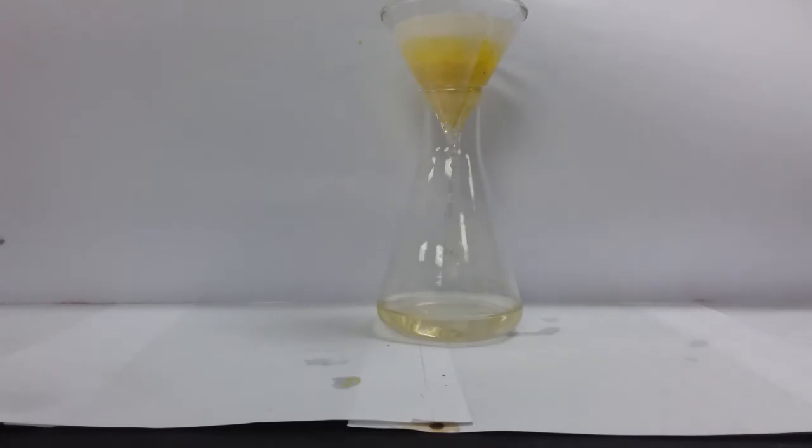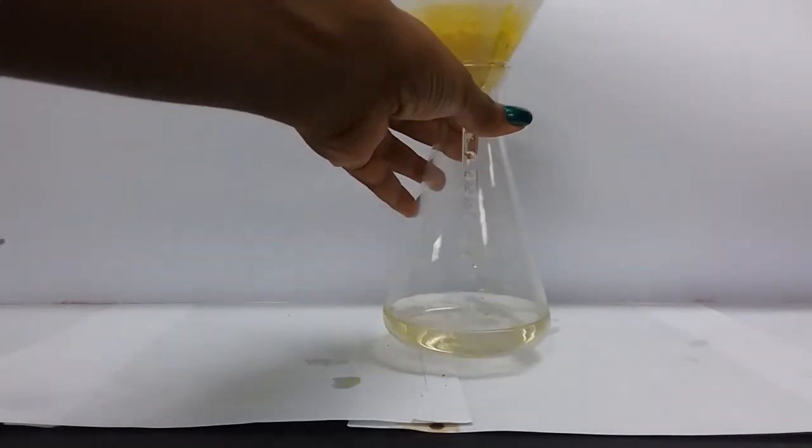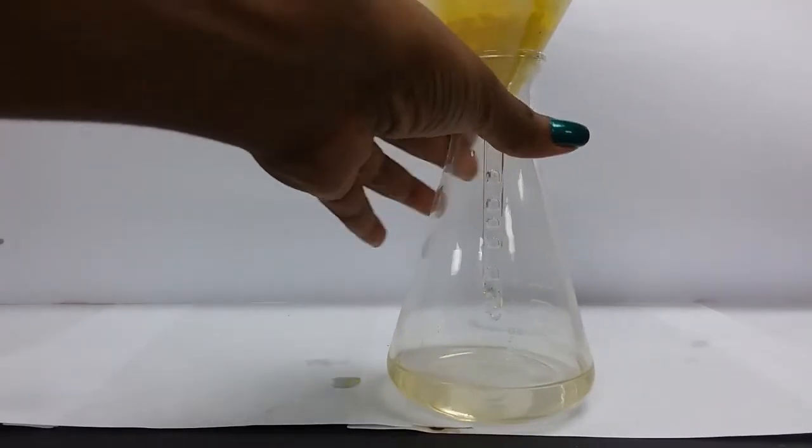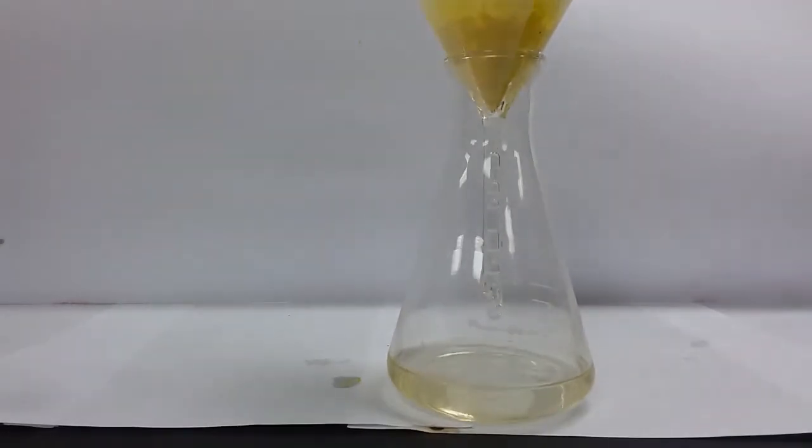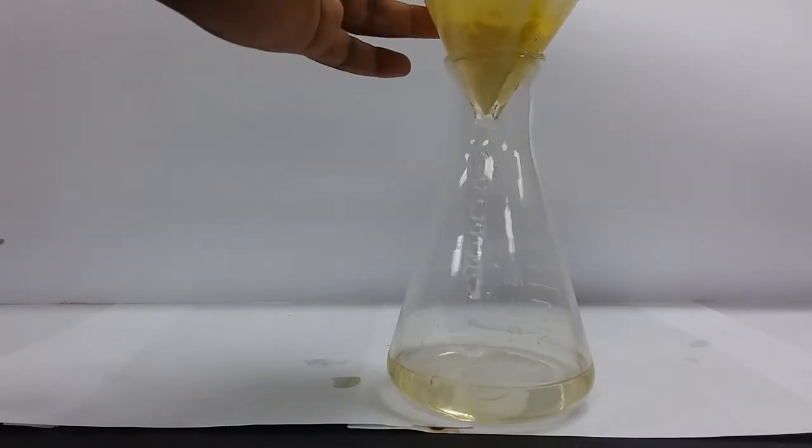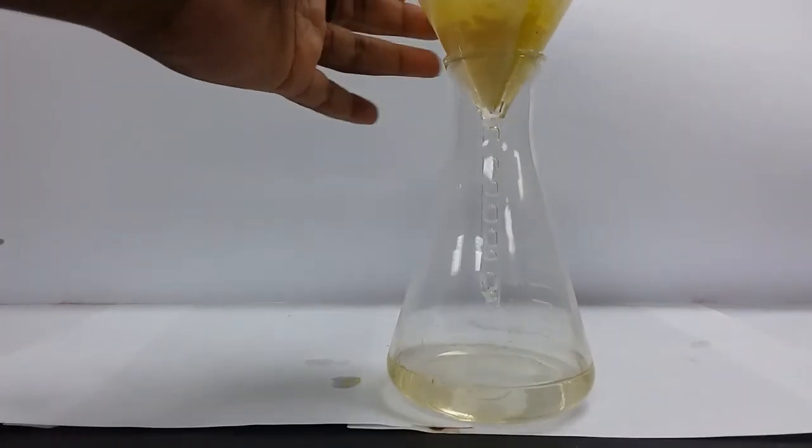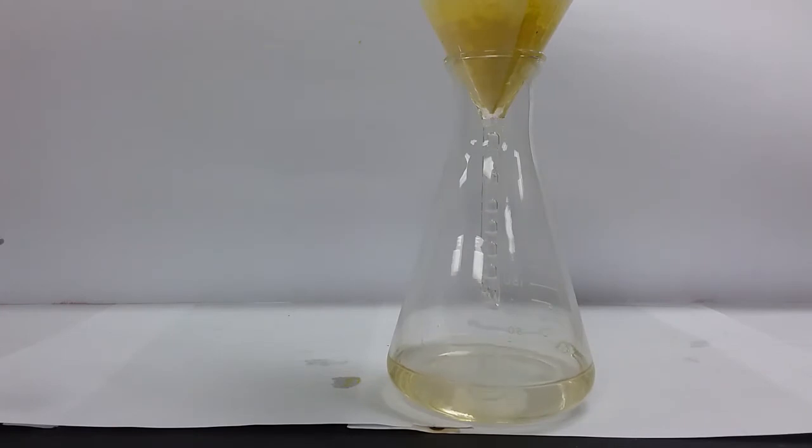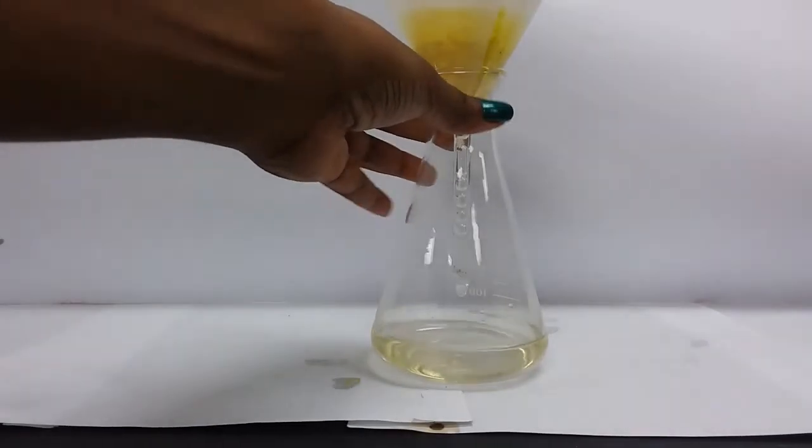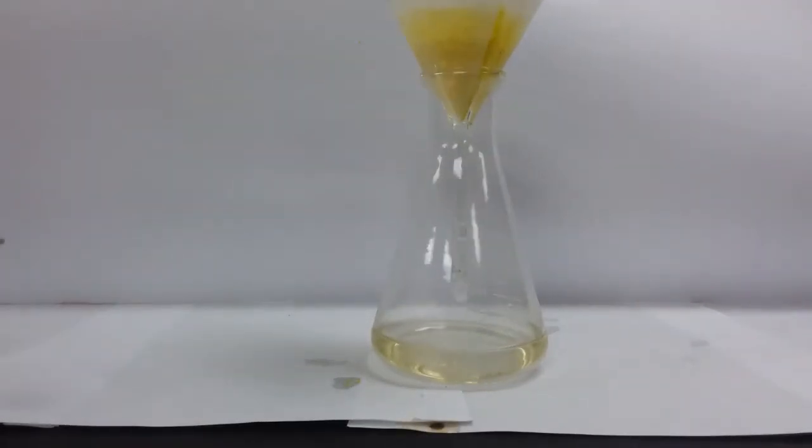So note the color of the filtrate. And of course, once this has settled, we'd note the color of the residue. Even though it looks a little bit yellow, let's record our filtrate as colorless, please.